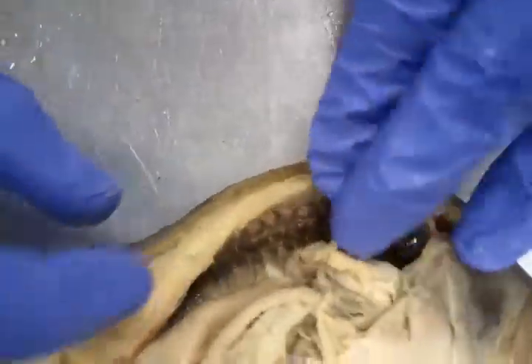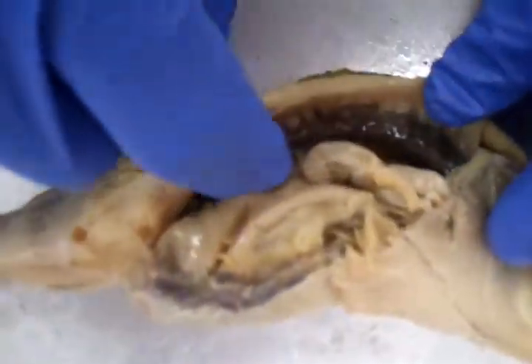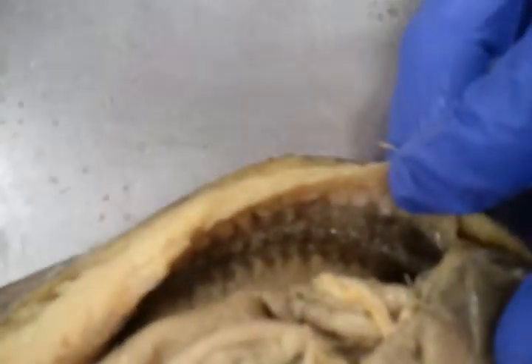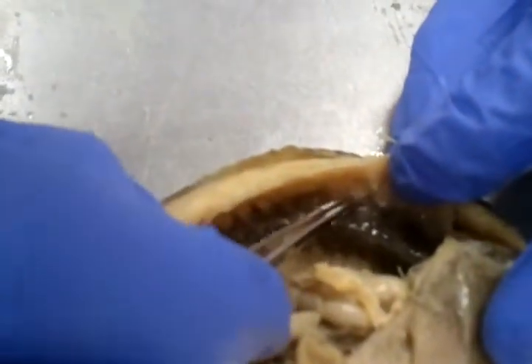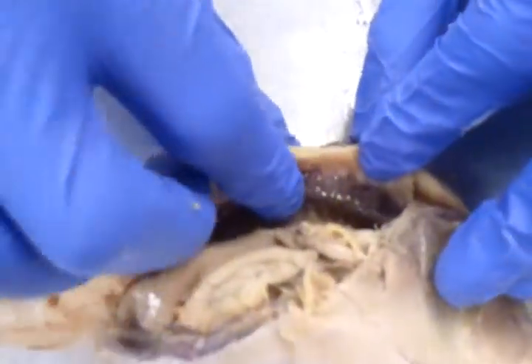Very important. Now, interestingly enough, this particular fish has its kidneys right in amongst its vertebrae. You wouldn't even imagine that this is an organ, but indeed it is. And you know it's an organ because if you take your pliers, you can gently scrape it off. I don't want to remove too much. All right, so we have the vertebrae and we have the kidneys.